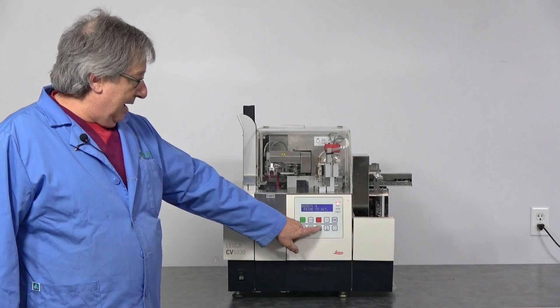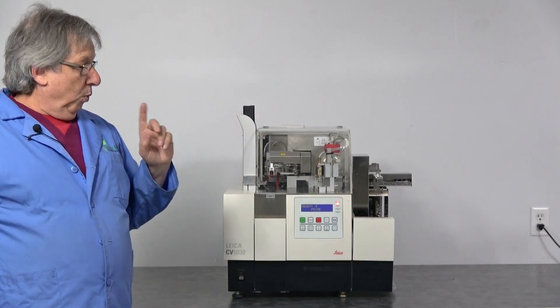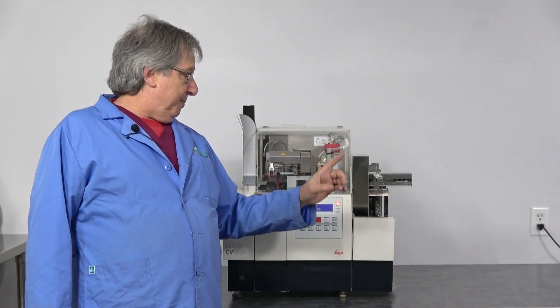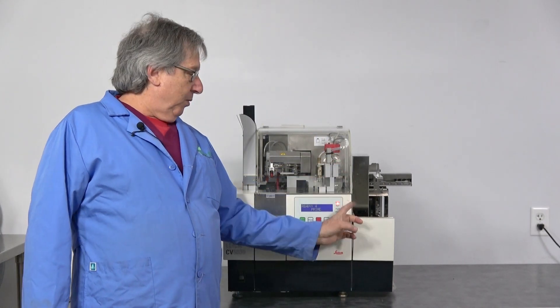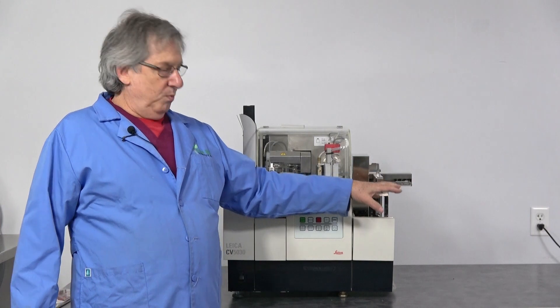The prime is something else you do. You activate it and it primes. One of the machines we just got in, haven't processed yet but I've inspected it. That one doesn't have the transfer station, which is fine.